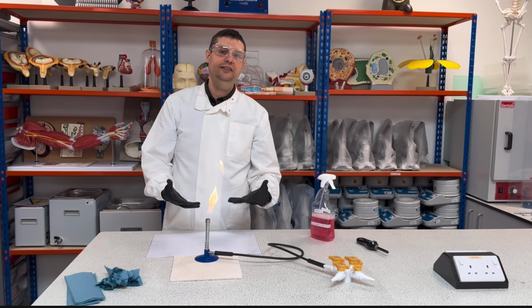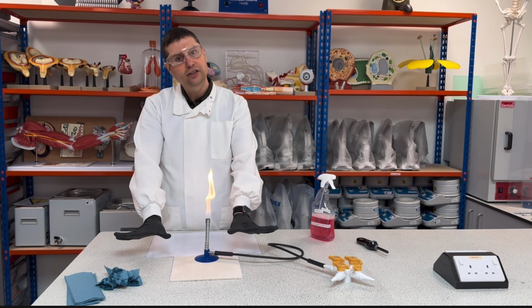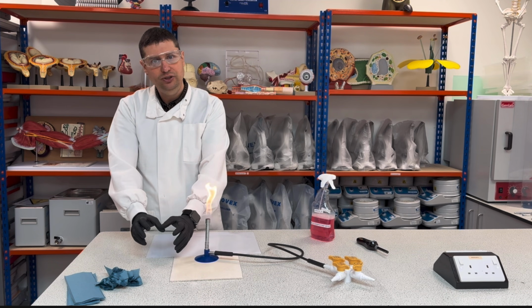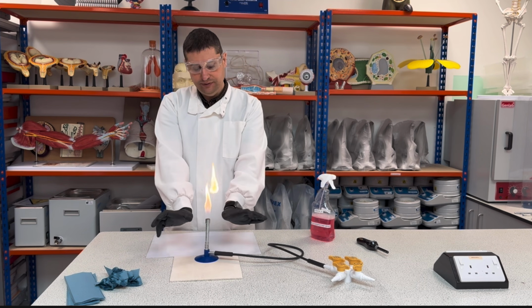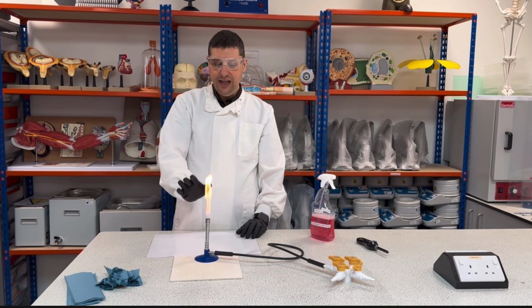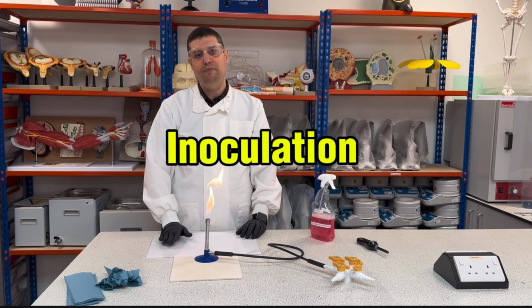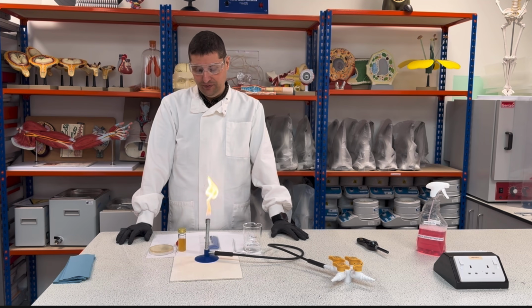If you don't feel confident enough to work with just 10 centimeters, you can work with another Bunsen burner on the side, so you're going to have 2 sterile areas added. So you need one here, so we have a big area to work in the middle, okay? But one gives you about 10 centimeters radius of sterility, okay? After this is all disinfected, I can start to inoculate my bacteria. So now we will go for the inoculation part, okay?